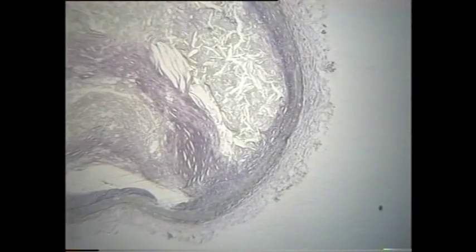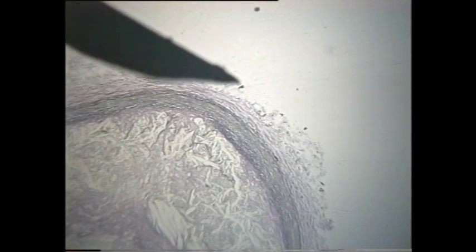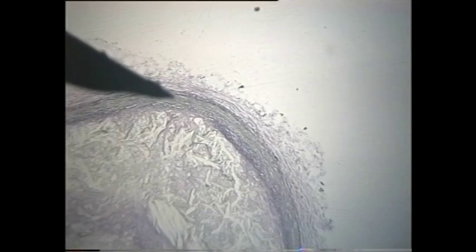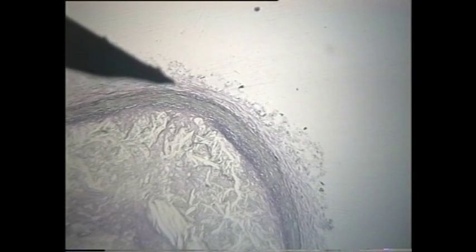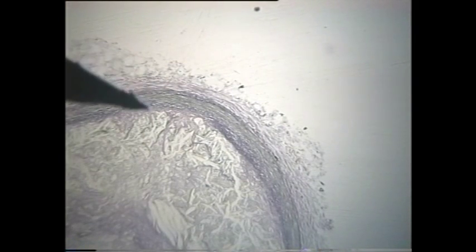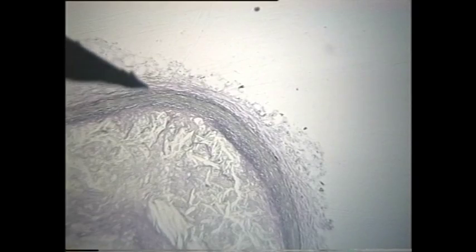Now here we're looking at another coronary vessel of a similar size to the one we've just looked at. Initially it's very hard to see anything at all, so let's point out some of the structures to orientate ourselves. What we're looking at on the outside here is the adventitia, then we're looking at the media, and there we're looking at the intima. So again: adventitia, media, and intima.